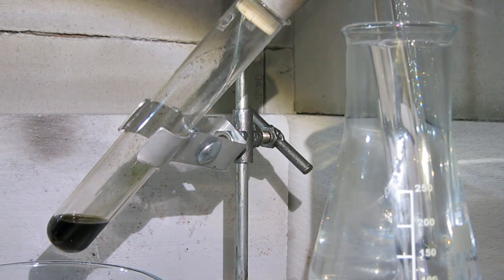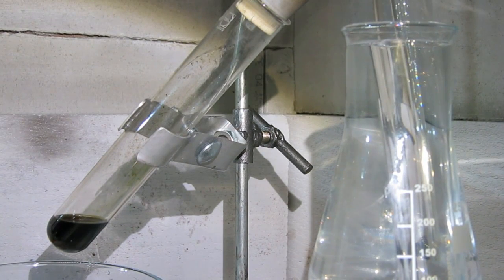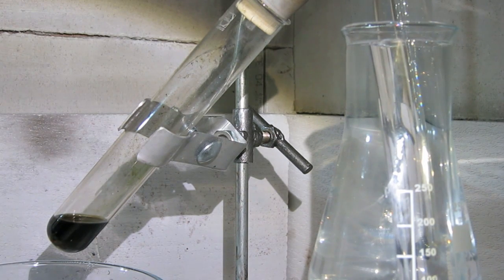A warning. Bromine is a very corrosive and toxic gas. So always perform experiments in a fume hood or otherwise outdoors.